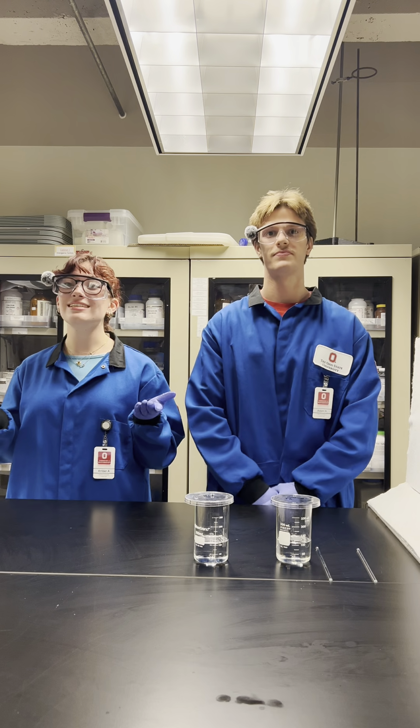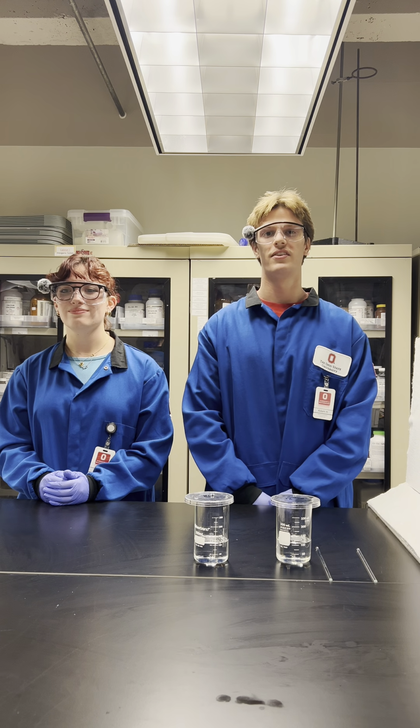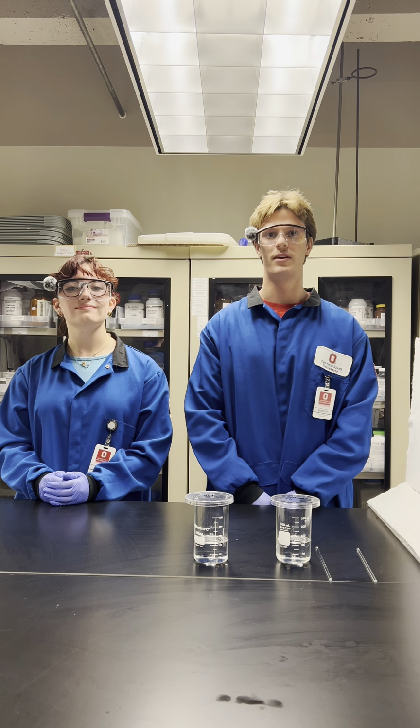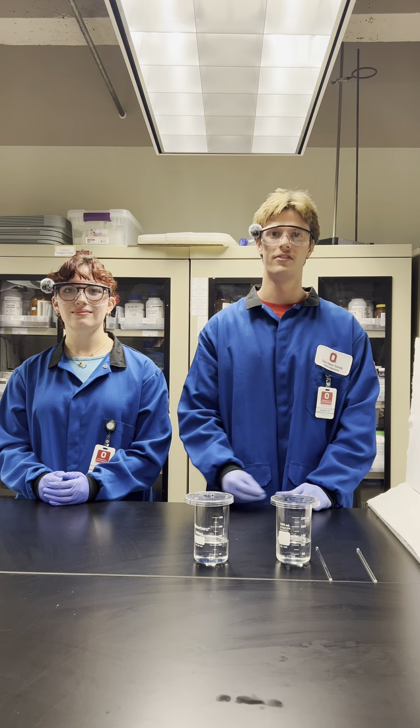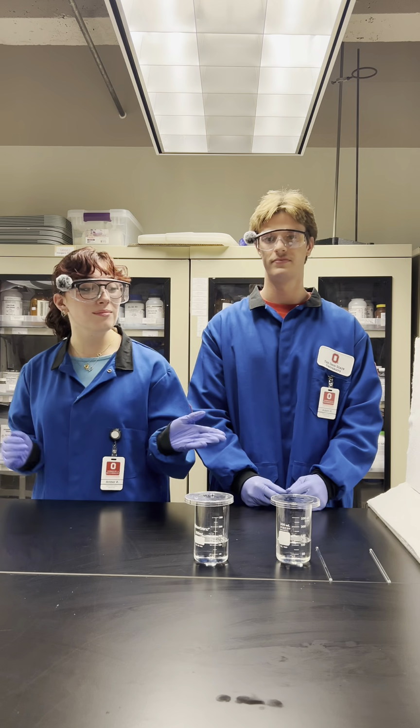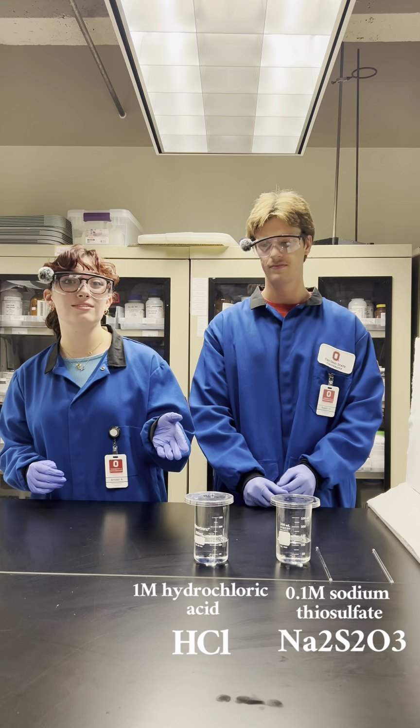Today we're going to be talking about the Tyndall effect. The Tyndall effect explains how different types of solutions interact with beams of light in different ways. And this has to do with the size of their particles and their suspension in solution. Here we have 0.1 molar sodium thiosulfate and 1 molar hydrochloric acid.